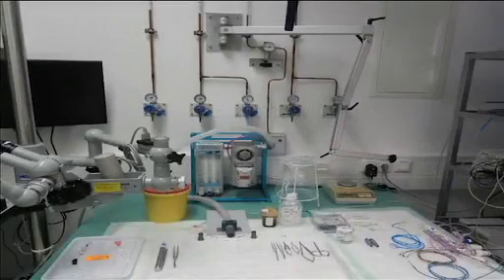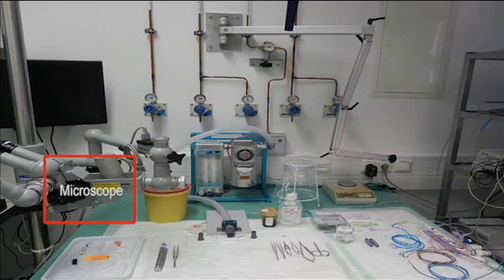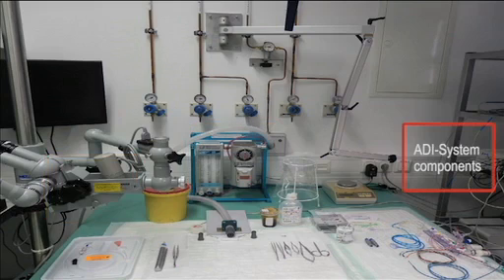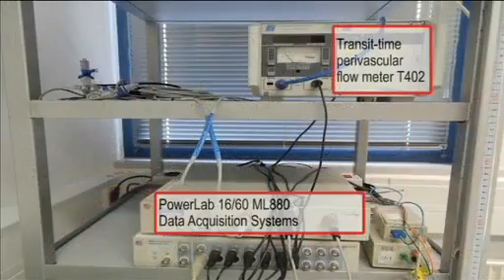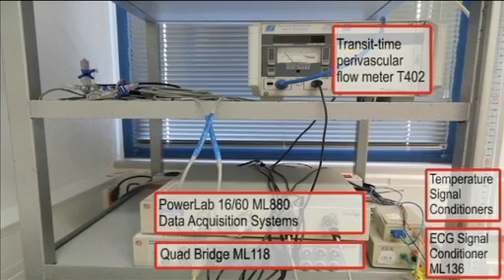What is needed for the full monitoring procedure is a computer with LabChart 7, a stereo microscope, an anesthesia machine and ADI system components. ADI system components include transit time perivascular flow meter, PowerLab and quad bridge for data acquisition. We also need temperature and ECG signal conditioner for recording the rectal temperature and heart rate.